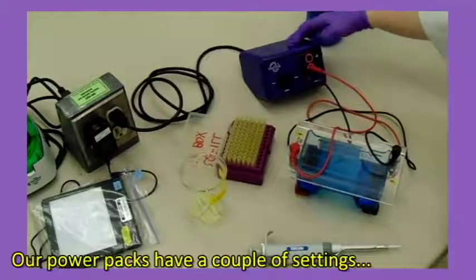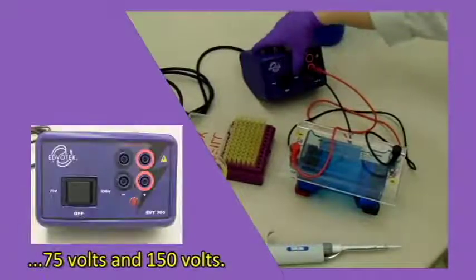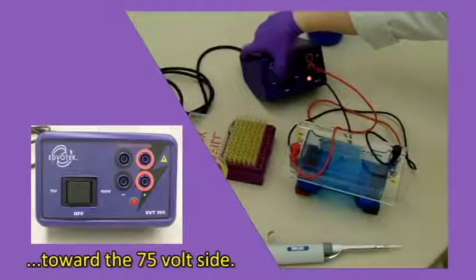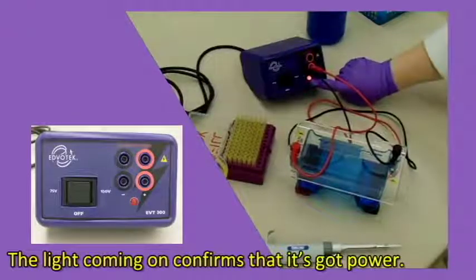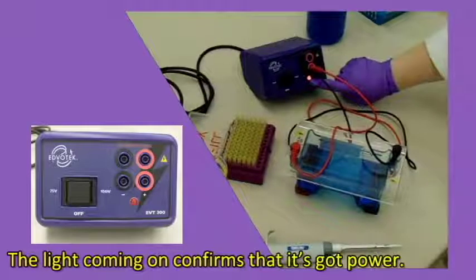Our power packs have a couple of settings, 75 and 150. We're going to push the rocker switch toward the 75. The light coming on confirms that it's got power.